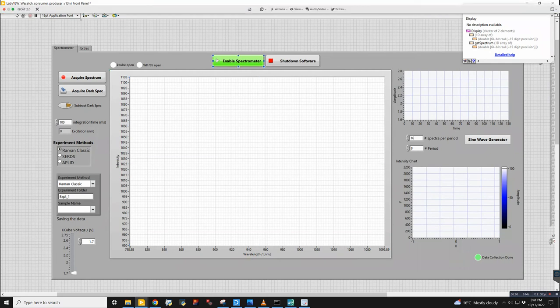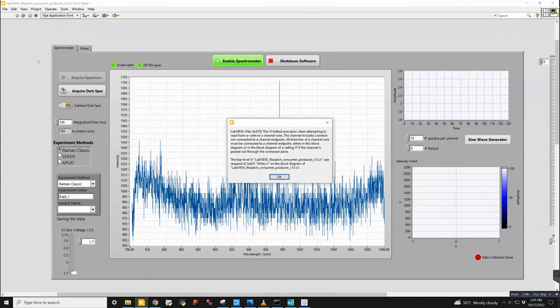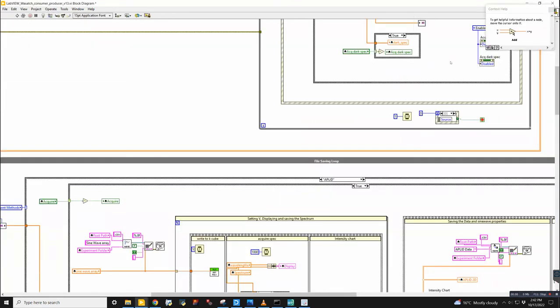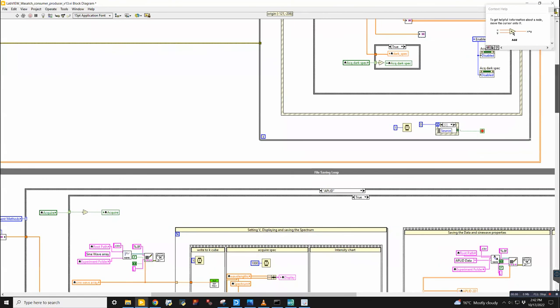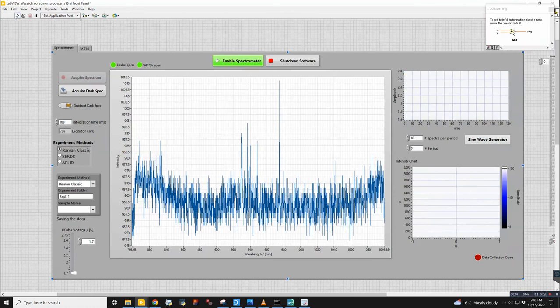Sweet. See if it works the first time. Ah, that's my fault. I did something dumb. Yeah, because I left this here. My bad. How dare I do that? Okay.